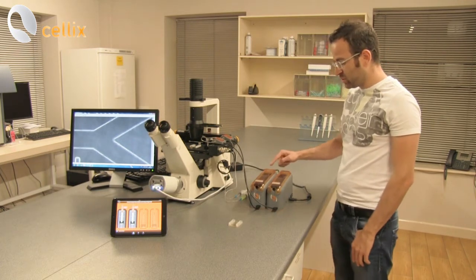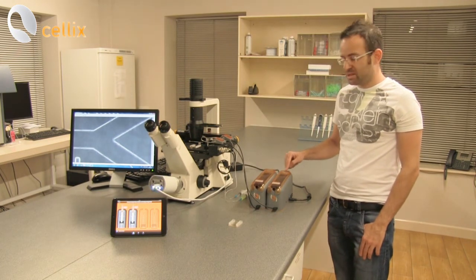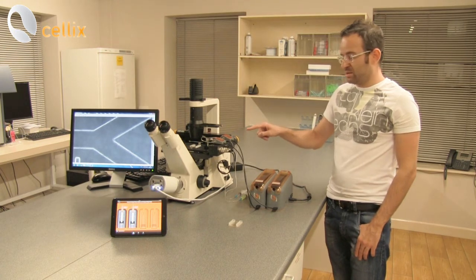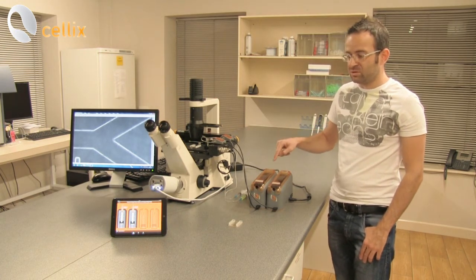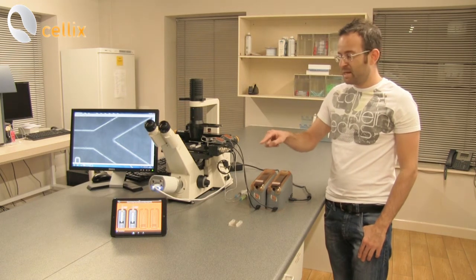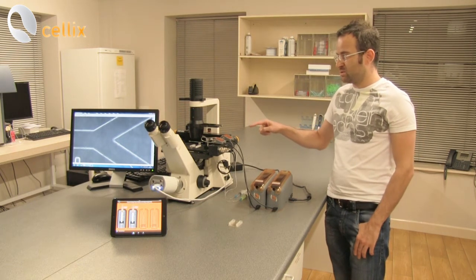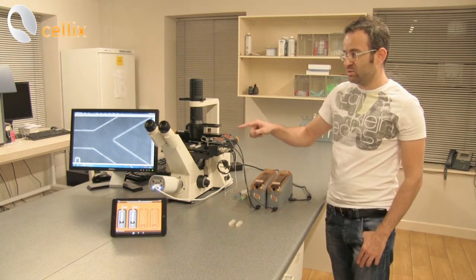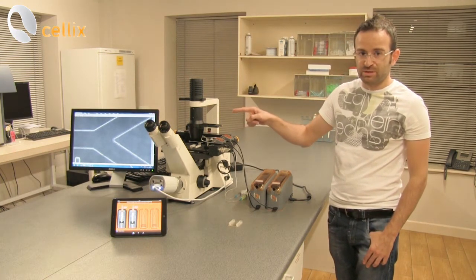We have two Exigo pumps, they are connected to the two Exigo sensors. The pumps are controlled by an iPad mini and the setup consists also of a microscope and a digital camera to image the experiment on the monitor.